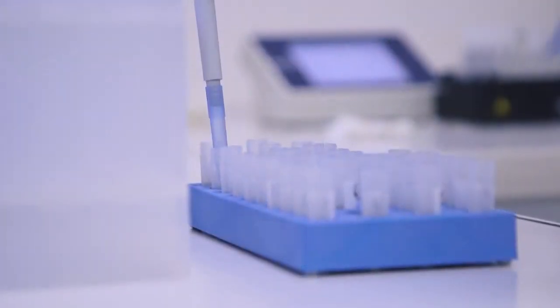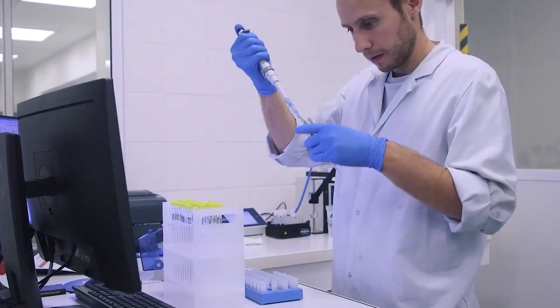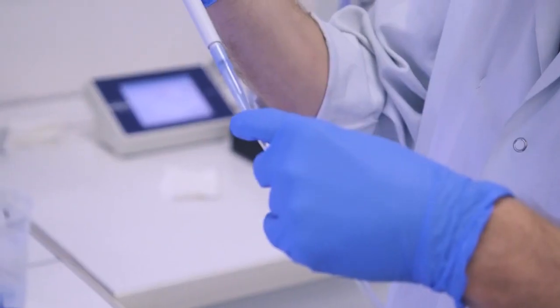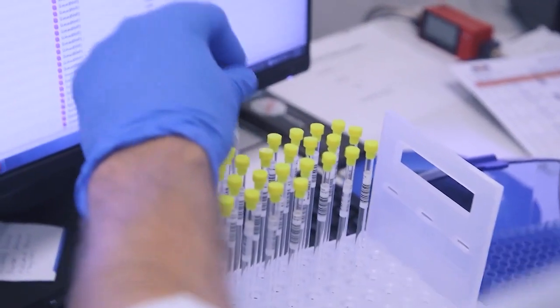When the pH has been adjusted, the sample can be transferred into an NMR tube and inserted into the sample changer of the NMR instrument.